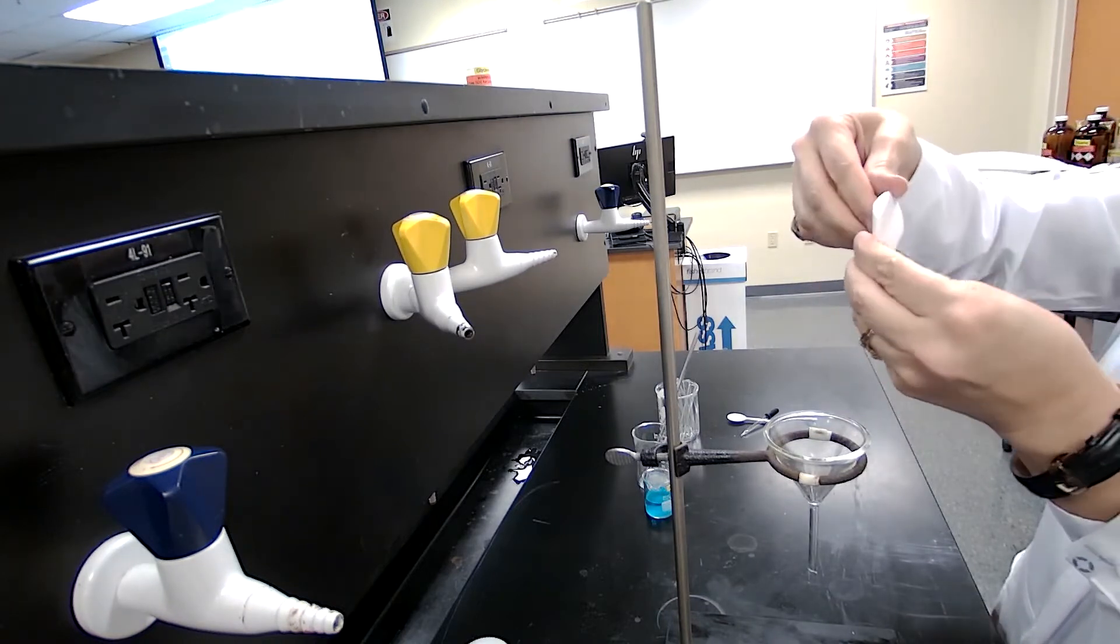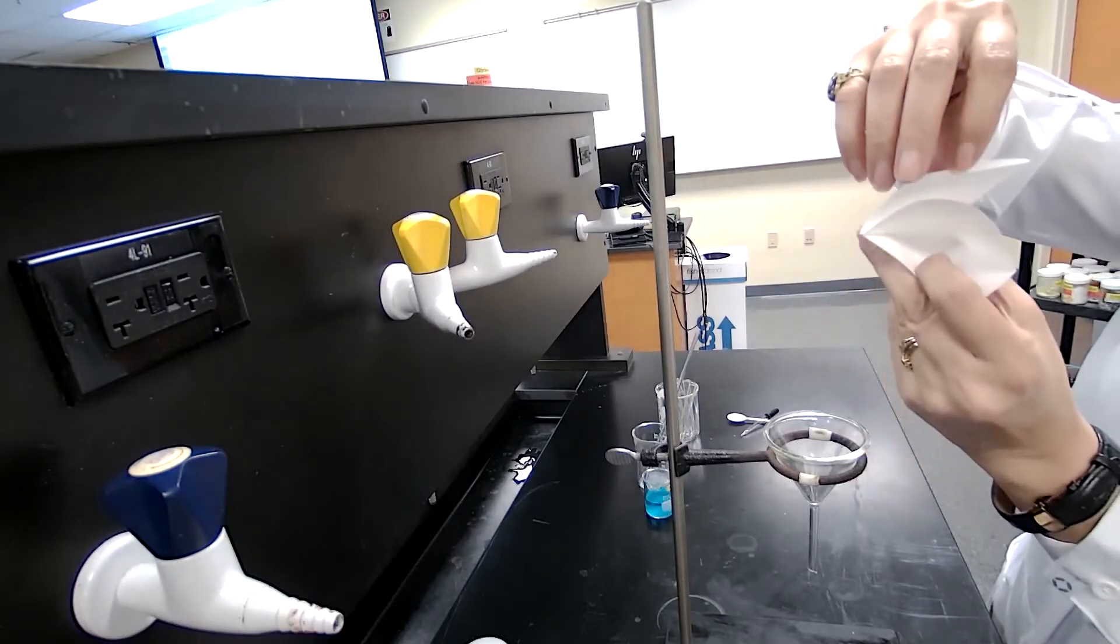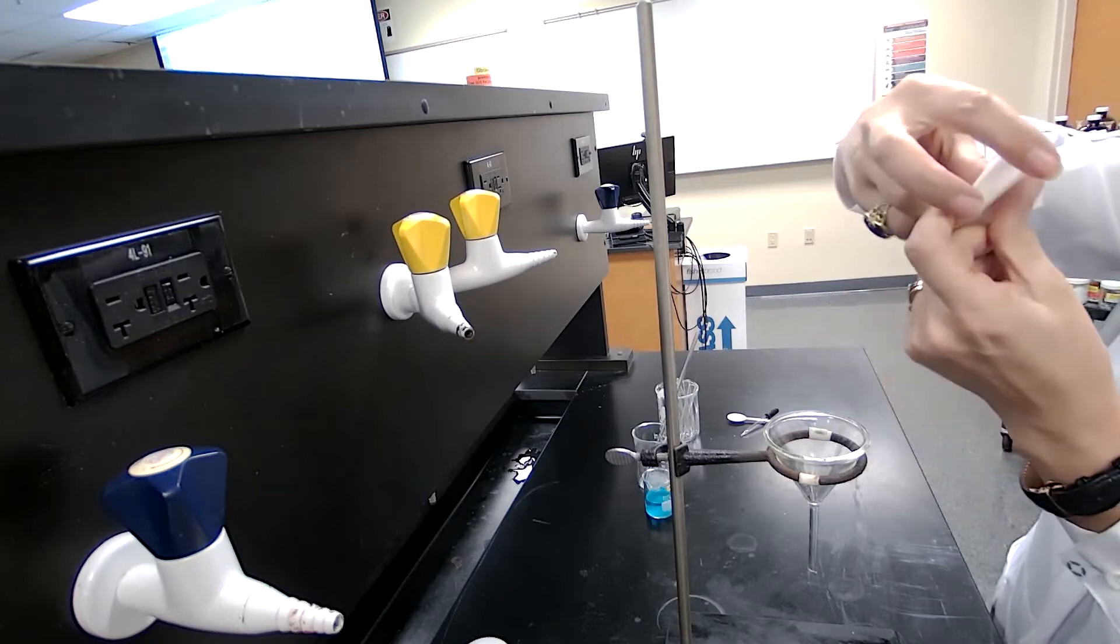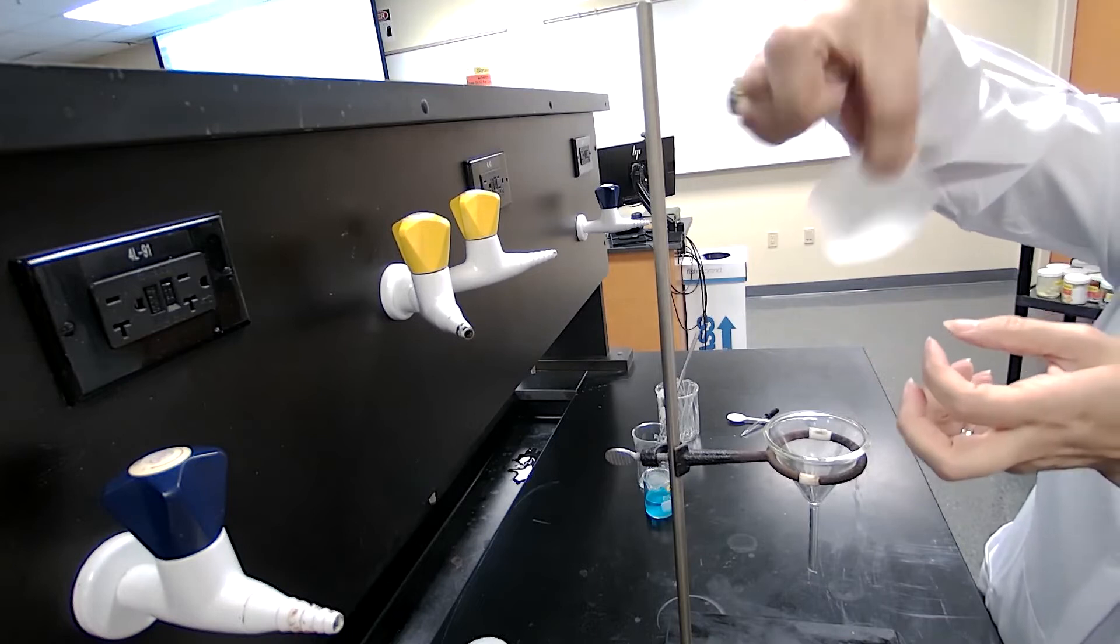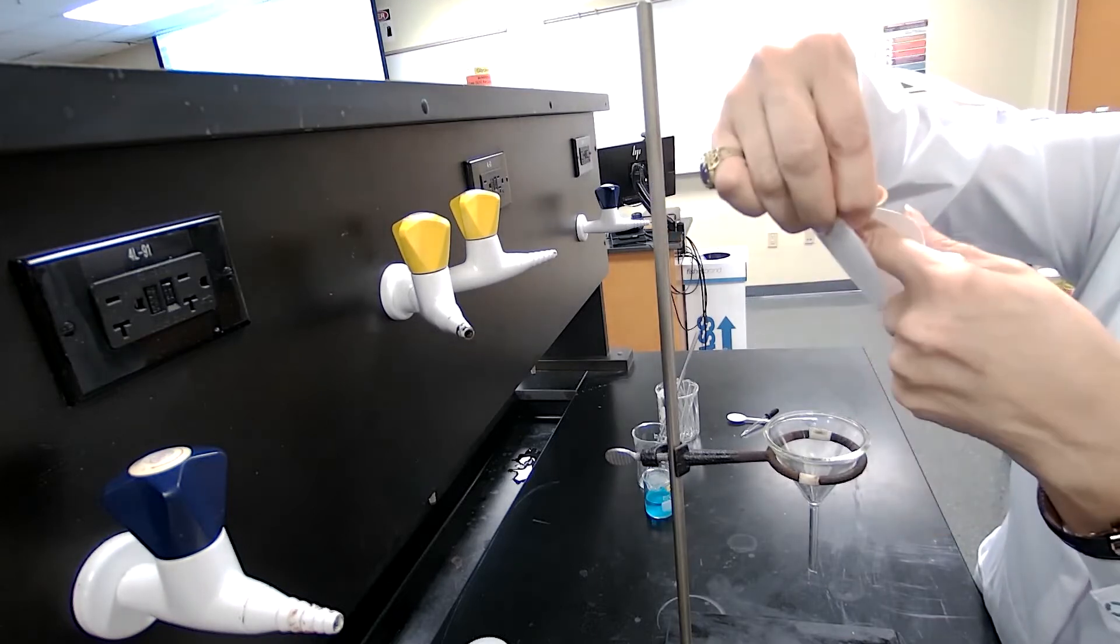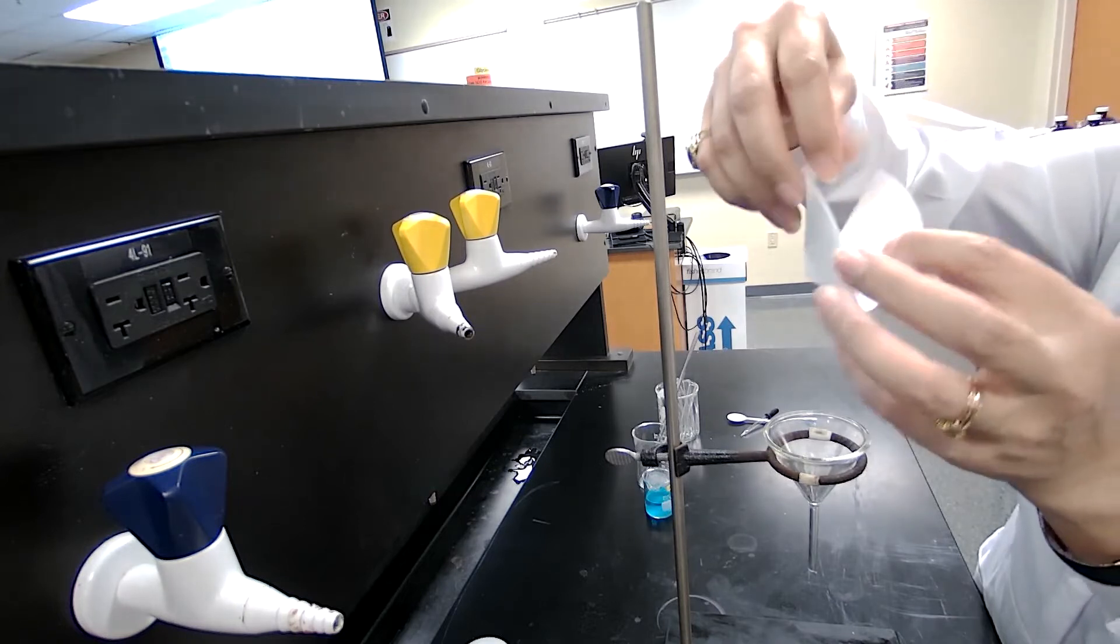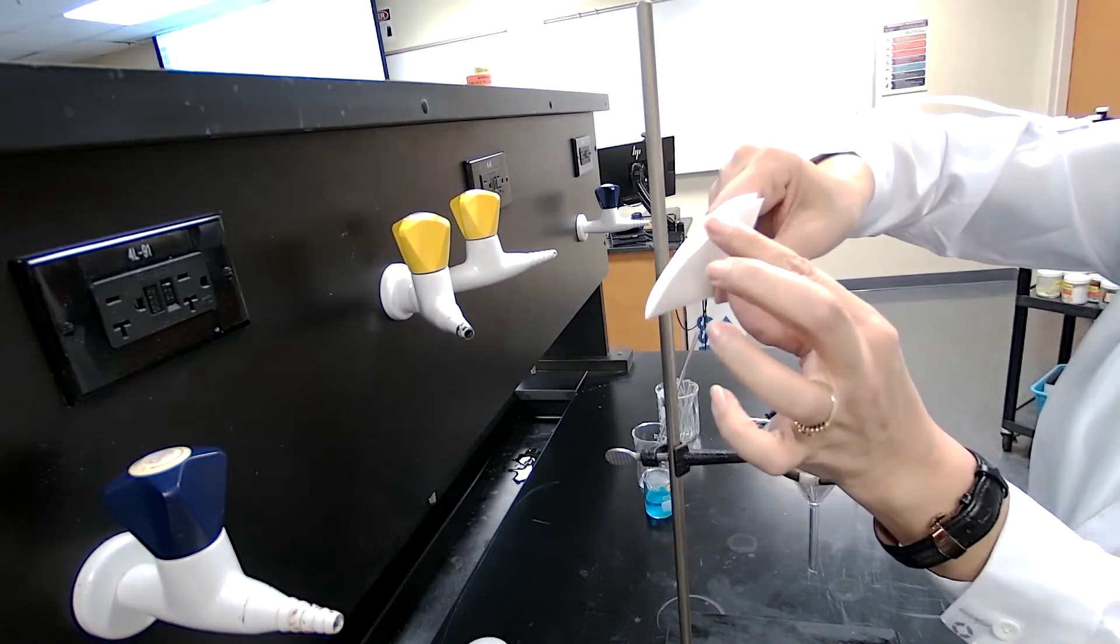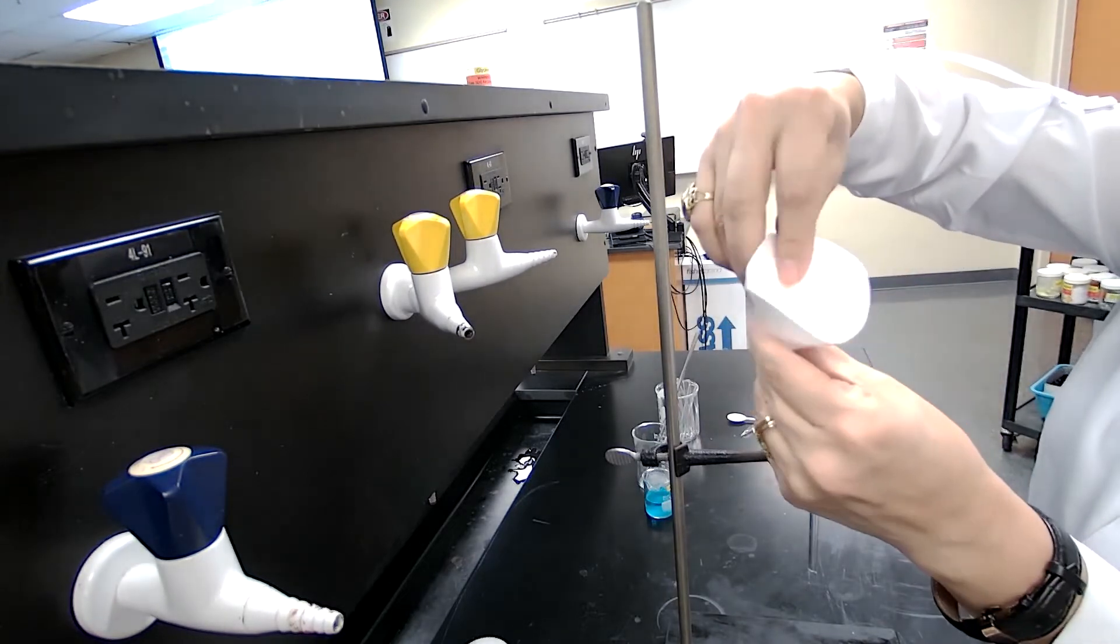Then I open it one part to one side, three parts to the other side. But I don't want it to happen like if someone folds it incorrectly and it's going to make a hole that the crystals or precipitate will pass through. So what you need to do after you fold it twice is one part on one side, three parts on the other side.